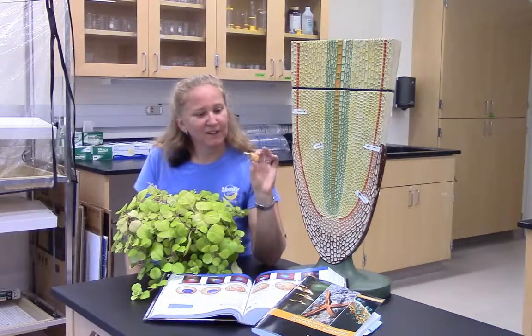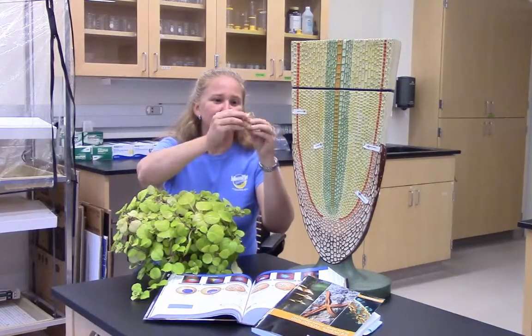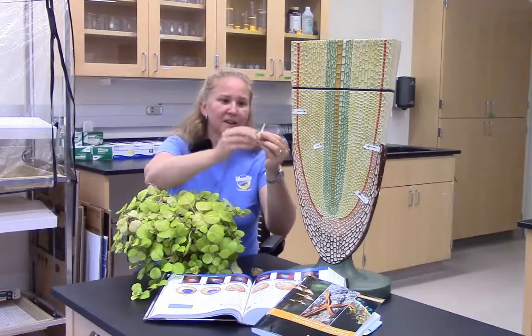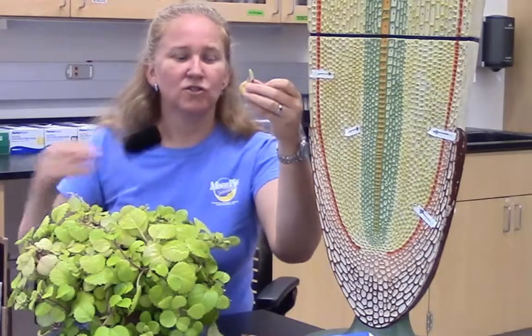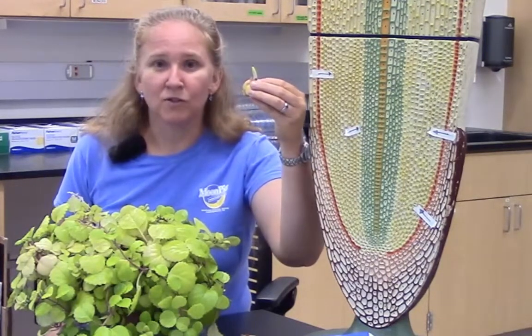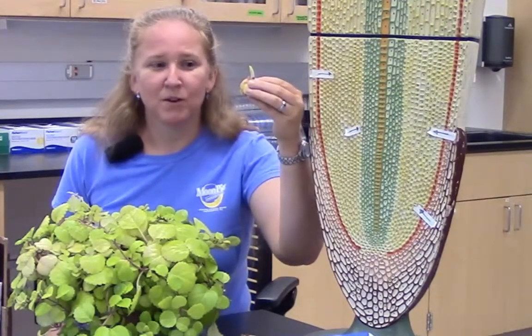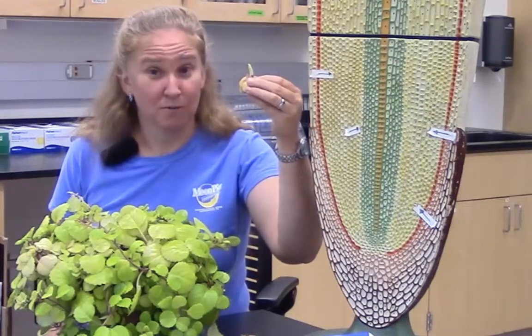So what am I holding here? I have a little tiny onion — like a little cocktail onion. You can see it still has the onion paper skin, but if I peel it away, what I see is that I've got a shoot that's emerging. And how is it that this onion is growing? Well, it's producing new cells by using mitosis. New cells are forming through mitosis, and of course if I were to plant this onion in the ground it would also grow roots.